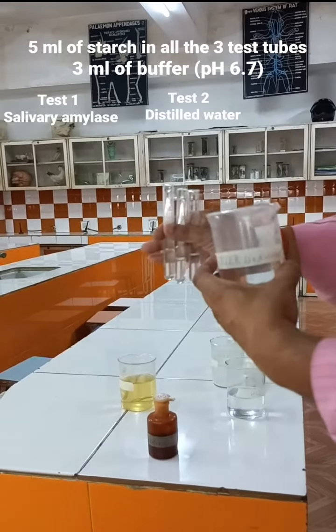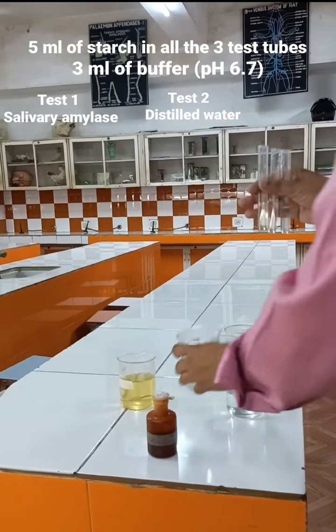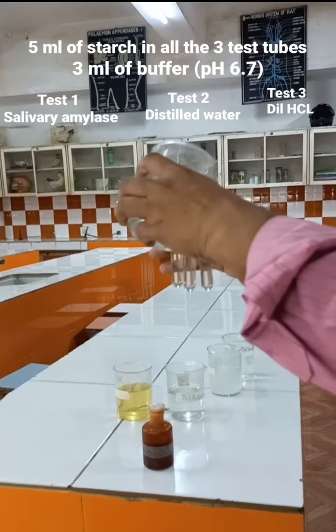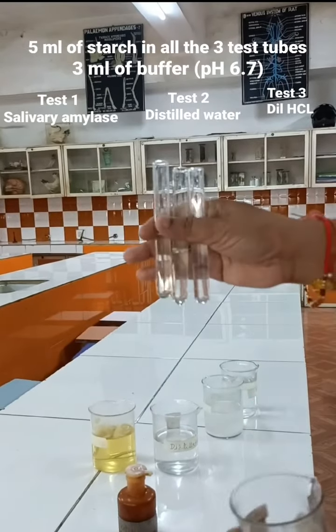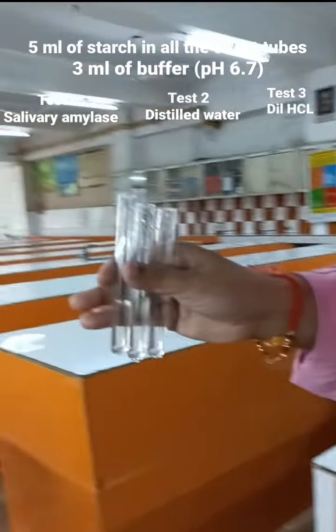In test tube number 2, you will take distilled water. Already starch and buffer solution is present in all the 3 test tubes. And in test tube number 3, you take dilute HCl. So test tube number 1, I have taken salivary amylase. Test tube number 2, I have taken distilled water. Test tube number 3, I have taken dilute HCl.